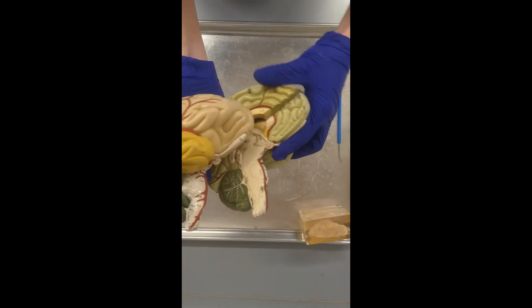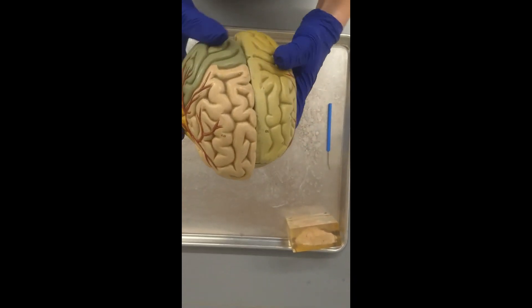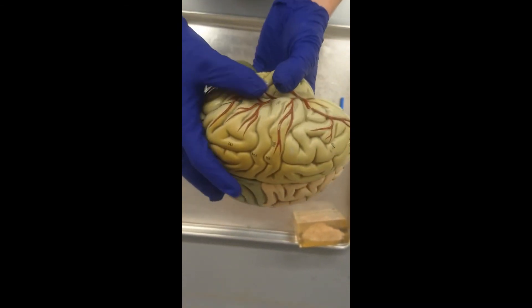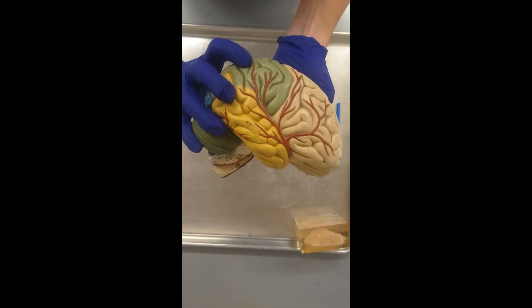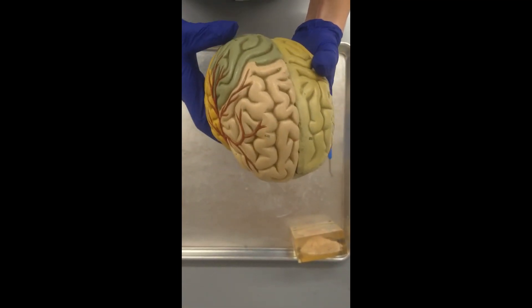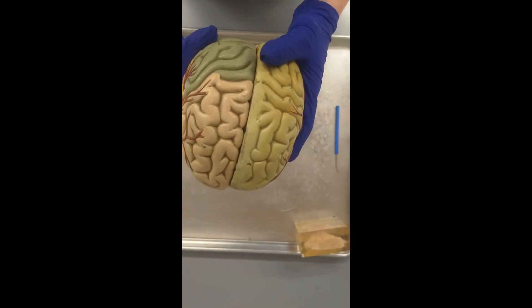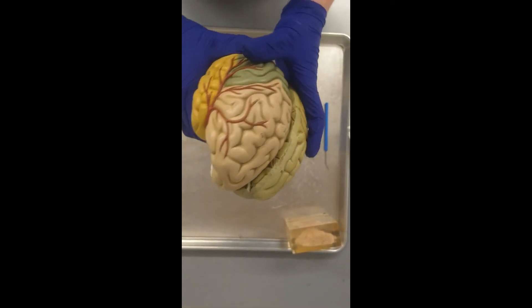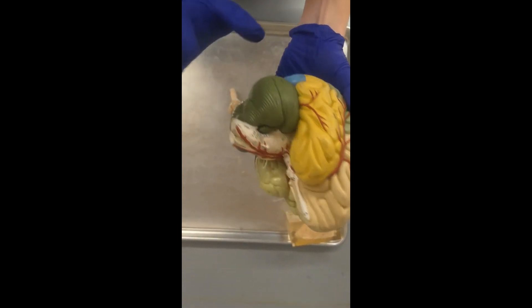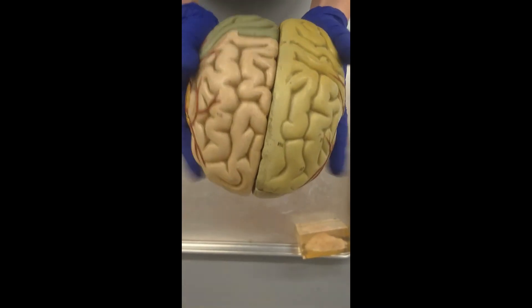We are dividing our dissection today into different regions: the cerebrum, which is part of the telencephalon — what we all know and love as our brain. We're also doing the diencephalon, which consists of structures on either side of the third ventricle. Then the brainstem, which is the mesencephalon, metencephalon, and myelencephalon. And then the cerebellum itself. We just took care of the external structures of the cerebrum.